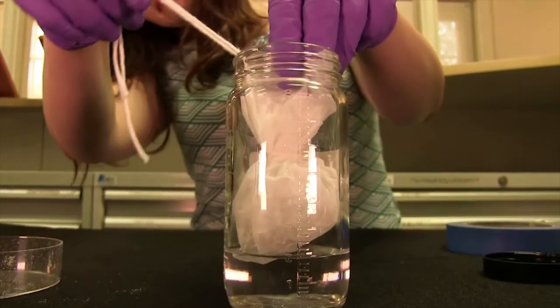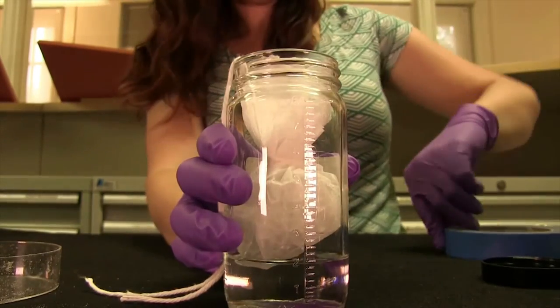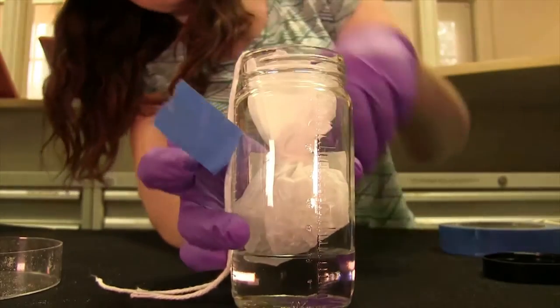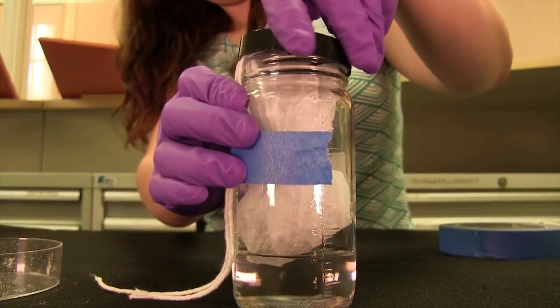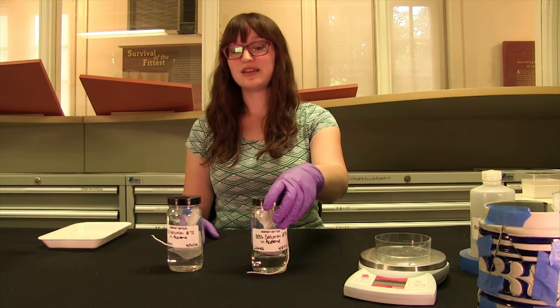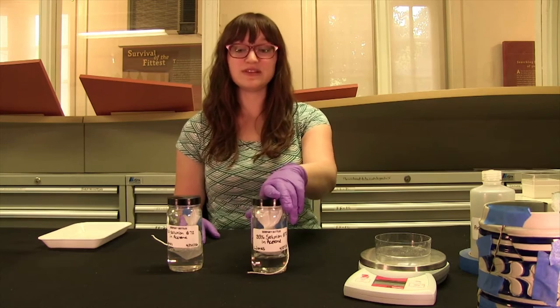I'm going to suspend this in the jar so it just touches the acetone. Acetone is a really good solvent, so overnight all of the B72 will be dissolved. This is a really controlled way of doing it. This is the glue we just made and it needs to sit in a ventilation hood for 24 hours to slowly dissolve.